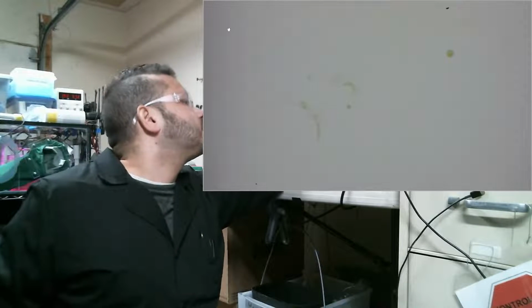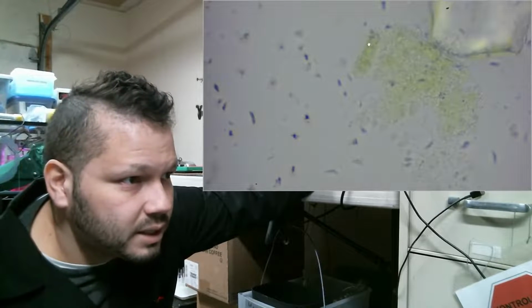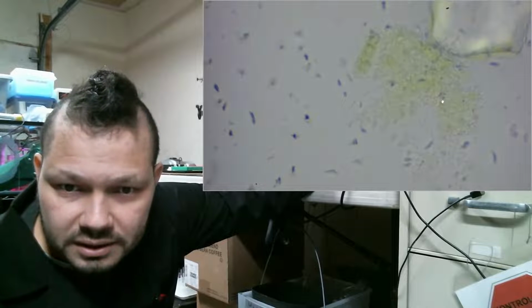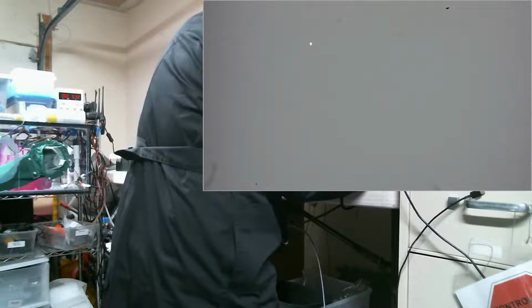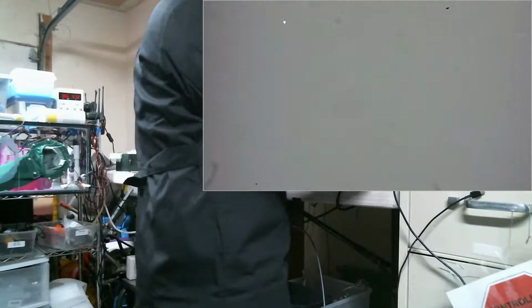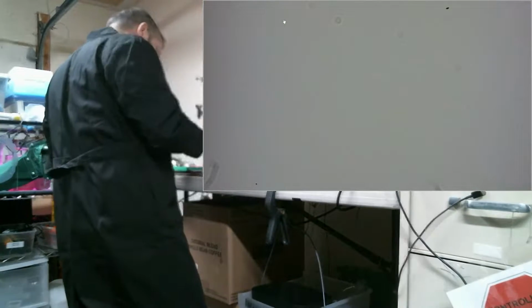Now let's see if I can do a... What is that? Because this right here looks like it seems like it's a somewhat intact algae, but it just looks like the cells just essentially... here's another one. But let's do the, let's see, 100, 4,000. Let's try the 4,000. Okay, so that's enough of that. Let's move on to the other ones.